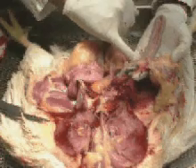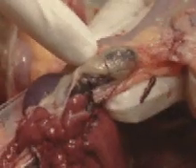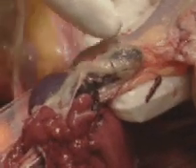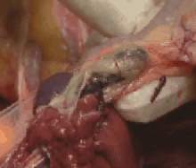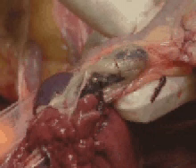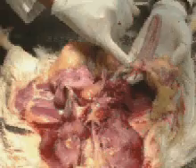On the ascending loop of the duodenum we encounter the gallbladder. The gallbladder is connected to the intestine by the bile duct, and this is where bile is added to digestive content for fat digestion.